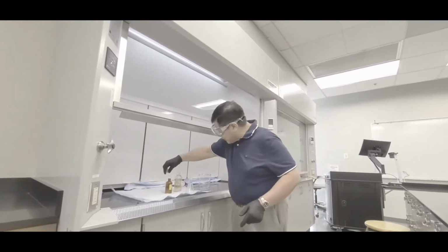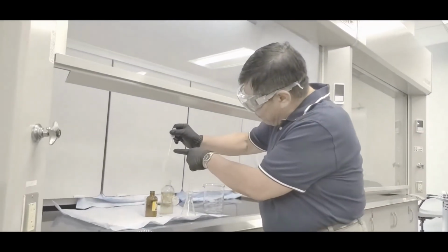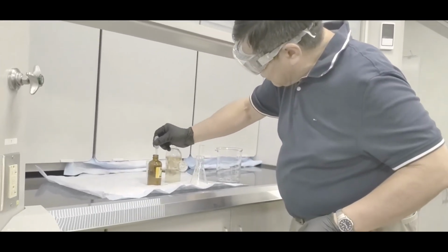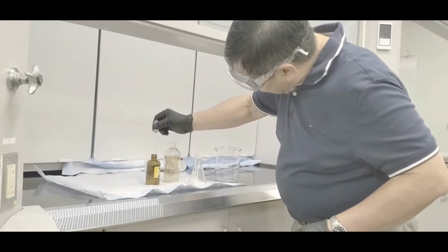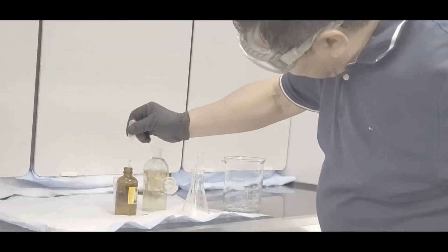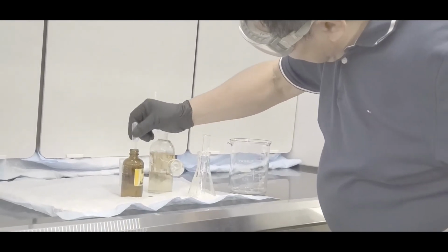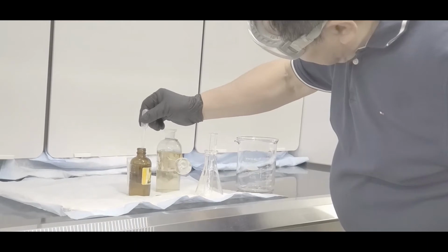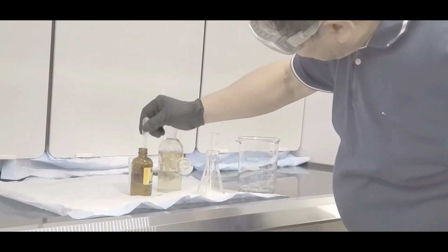So in that case, what you do is squeeze, see right there? The mark on the pipette tells you how much to put in, so okay, let's get rid of some of it. You don't want too much, you want just about enough. Okay, that's about right.